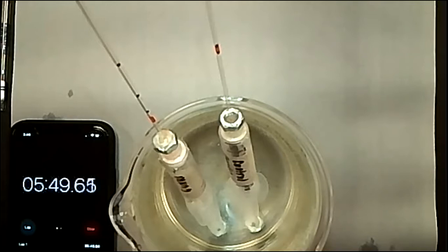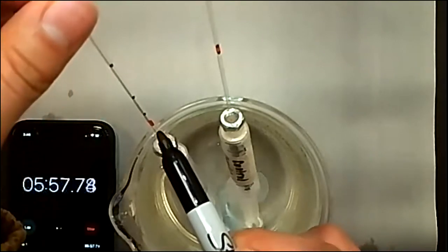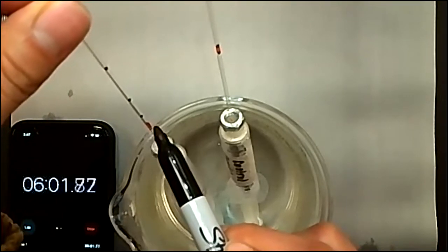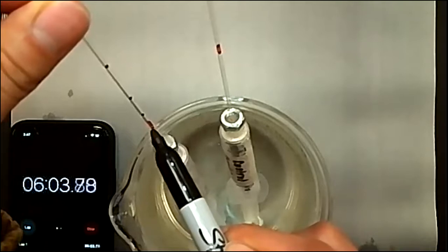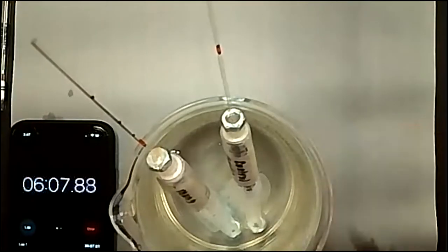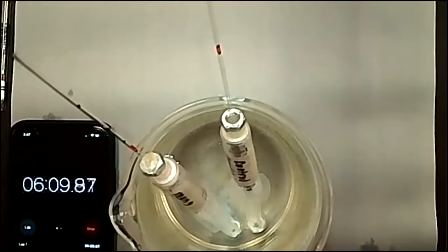So we're coming up on the 6-minute mark. To be fair, if you already understand the data collection method after I explain the other parts, then you would be able to just move on and just go to the final data collection points. But as you can see, our respirometer for our control is no longer changing.